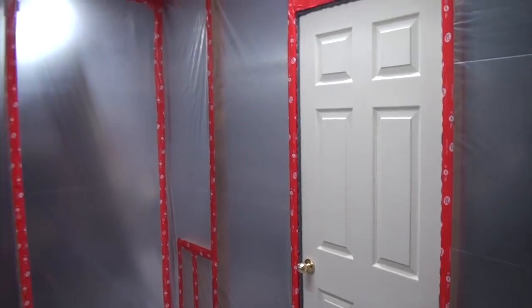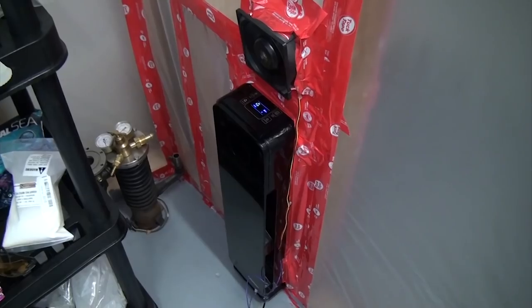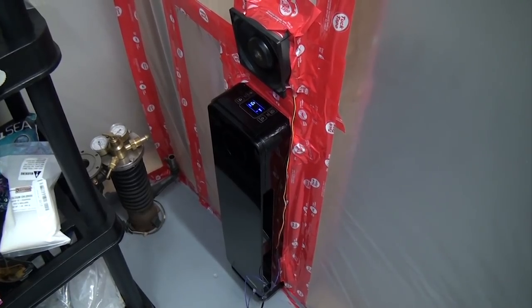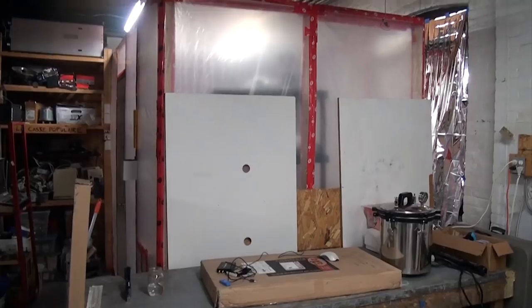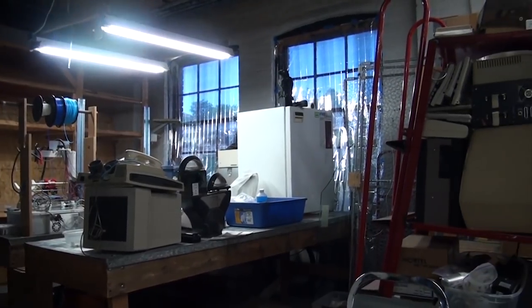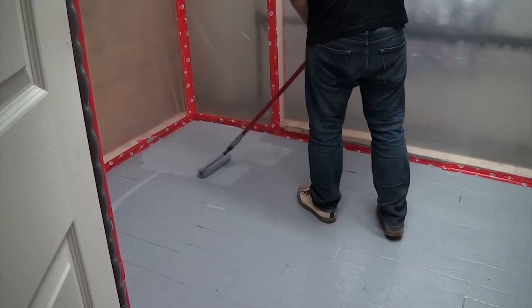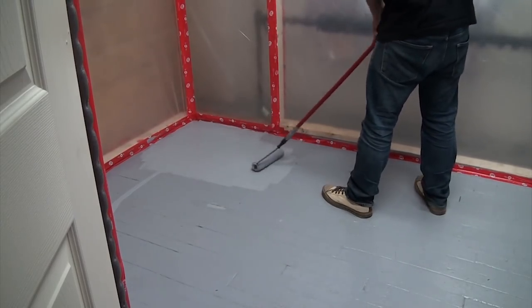Since I have no intention of working with anything pathogenic or dangerous, the lab is built as a positive pressure room. All the air that enters first passes through a filtration unit that has a built-in carbon filter, HEPA filter, and UVC bulb to make sure that the air is nice and clean. This way, the lab will stay dust-free, and there'll be a lot less stuff floating around that could fall into a dish and contaminate things. And anything that leaves the room won't be any worse than what's already floating around in the very dusty workshop. Honestly, this is overkill, but because of how dusty the rest of the space is, it's necessary for my location.